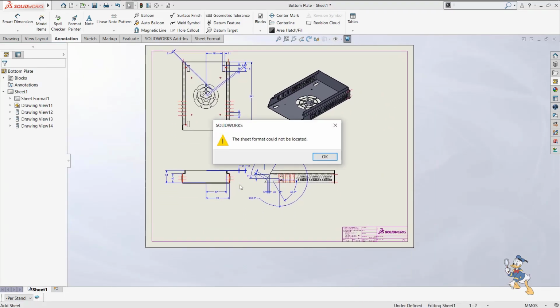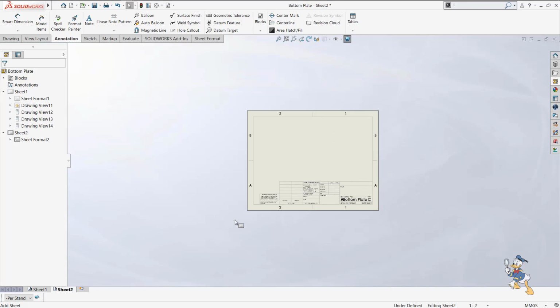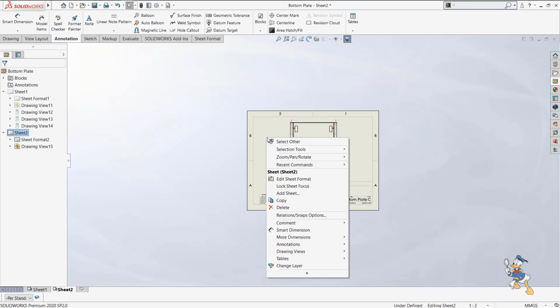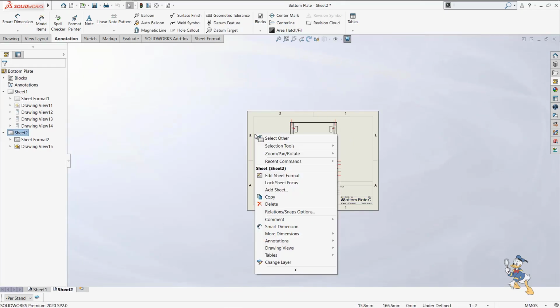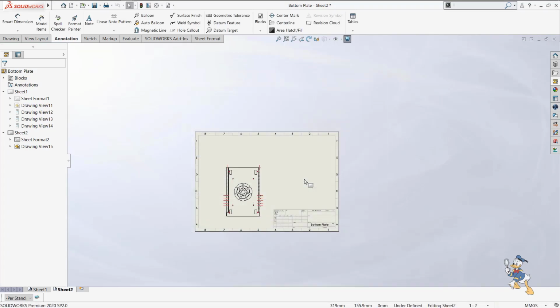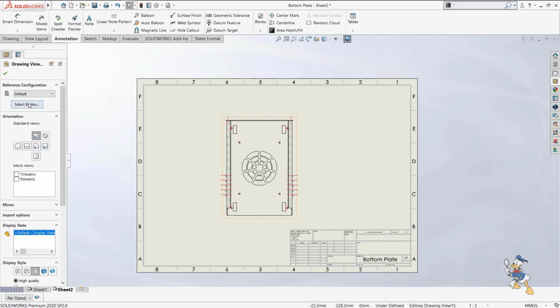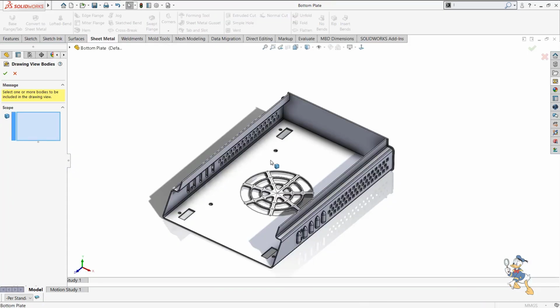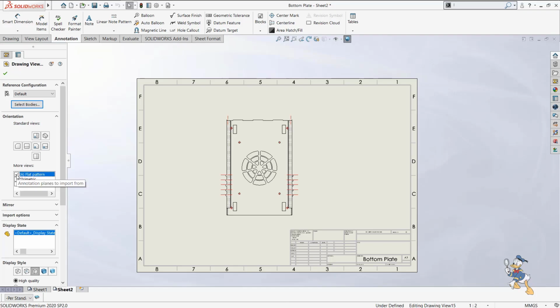And suppose we want to generate some sort of flat pattern view. If we really want to add a flat pattern view, we just need to select a view from the model. And suppose the sheet format is not suitable for us, we can change the sheet format as well. In Properties, we can select any other format as well. Suppose we need A3 size for this model, so it automatically changes. And for this one I need to generate a flat pattern. I need to select the body for which I need to generate a flat pattern. Suppose I need to generate a flat pattern for this body. I just need to check it, and it will give me an option of generating a flat pattern. I just need to select it.